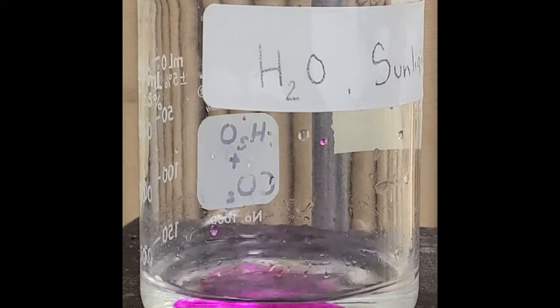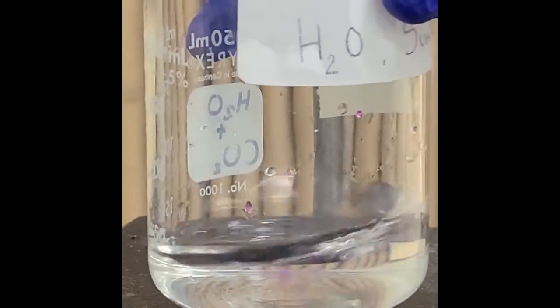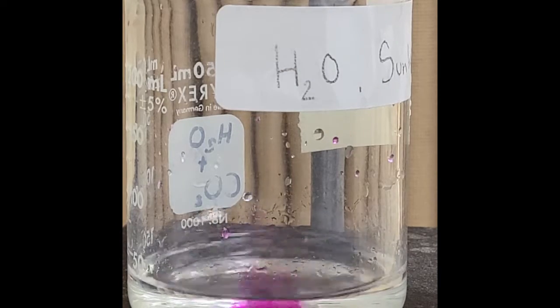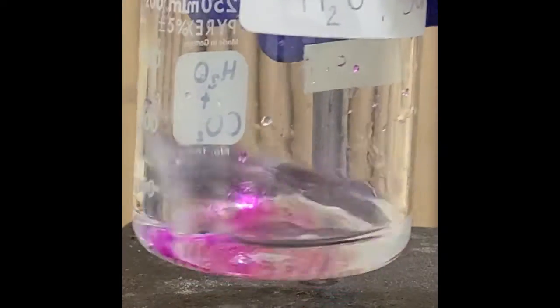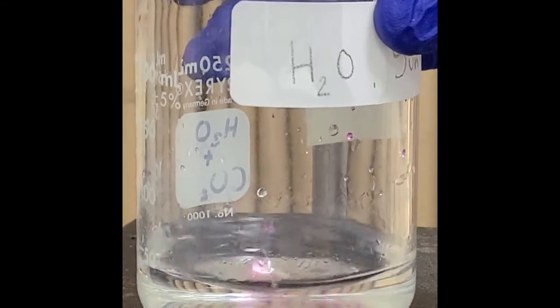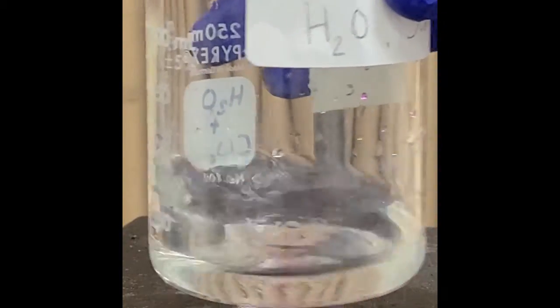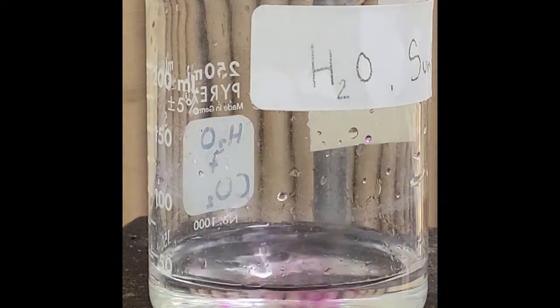This is sodium hydroxide. This is a fairly basic substance, approaching 13, 14 on the pH scale, depending on the molarity concentration. When this goes basic, it's going to go basic really quick, even by adding a couple drops. So we will know then that it's neutralized, and we'll have a pretty safe estimate as to what the molarity is, and we can use that as a gauge for our chemical reactions for hydrochloric acid, after we've done our stoichiometry, of course.